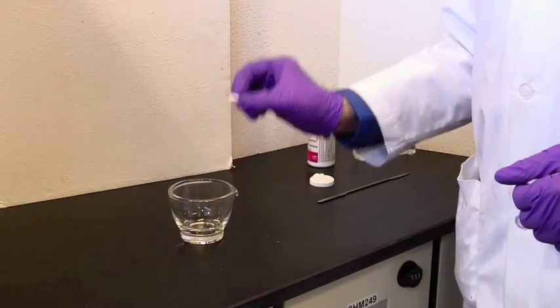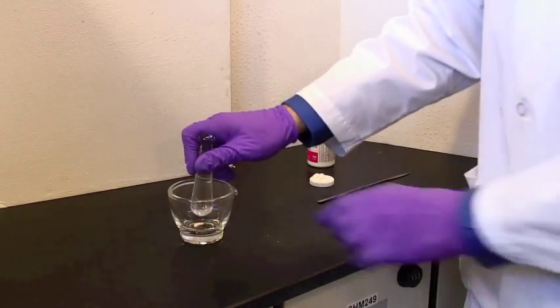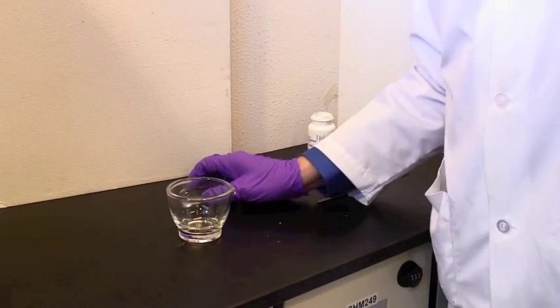At one point you may have to dissolve a really large lump, and that's a tablet. Again, if you really whack at this, you're going to end up with little bits flying all over the place. Not the best way to do it.